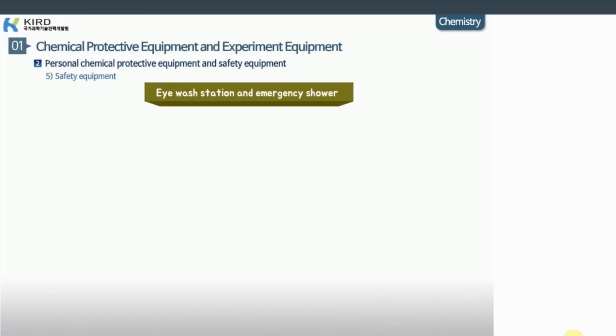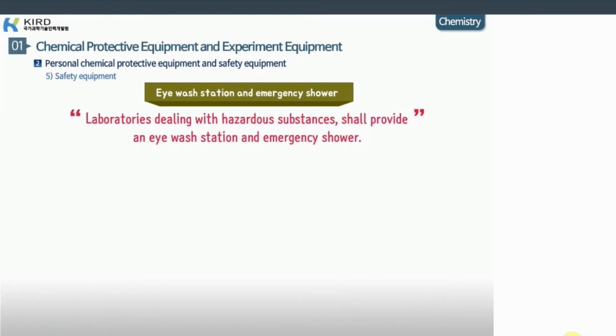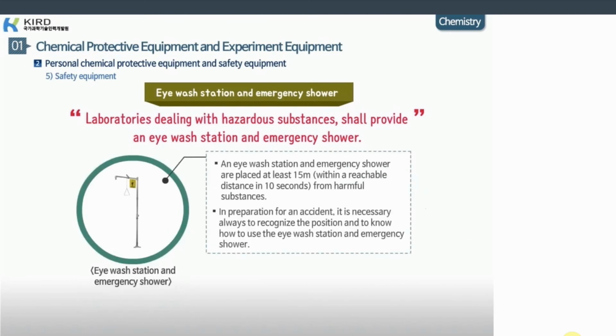Shall we take a look at the eye washer and emergency shower? Laboratories dealing with hazardous substances should provide an eye wash station and emergency shower. The eye wash station and emergency shower are placed within a reachable distance of at least 15 meters, reachable in 10 seconds from harmful substances. In preparation for an accident, it is important to always recognize the position and to know how to use the eye wash station and emergency shower.